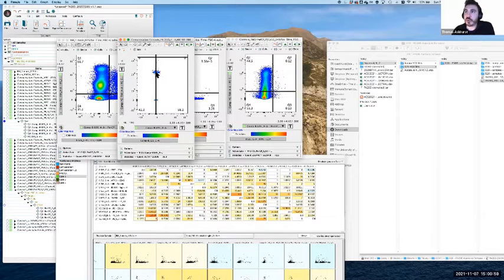So, what you'll notice here is if we make very minor changes, because the signal is moving dramatically like this, you could make a small change to the number. Signal that's lower down the scale will almost not move at all. Data that's high up on the scale will move quite dramatically. And so what I suspect is that, within the tolerance that the calculations have, it thinks the single stain has been corrected sufficiently, but it's just gone a bit too far in the real sample because we haven't given it a bright enough single stain control to really map that full range properly.